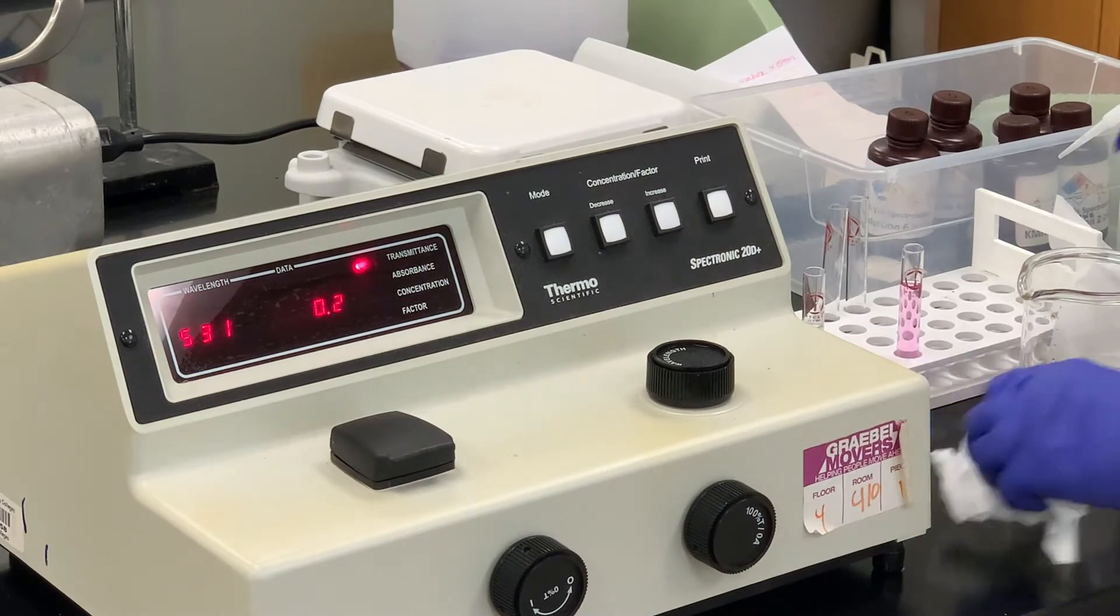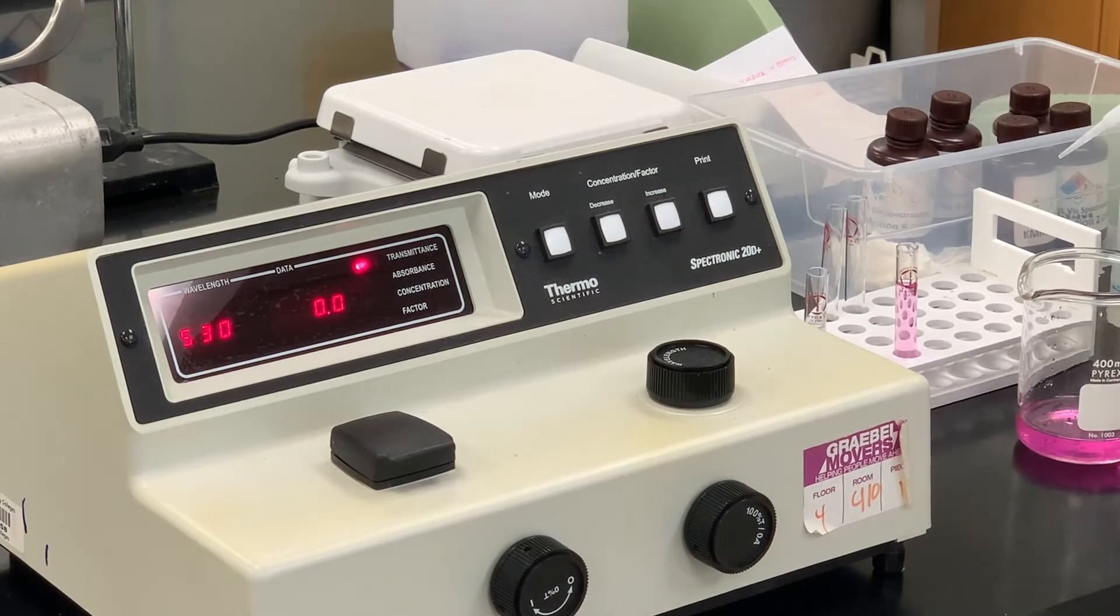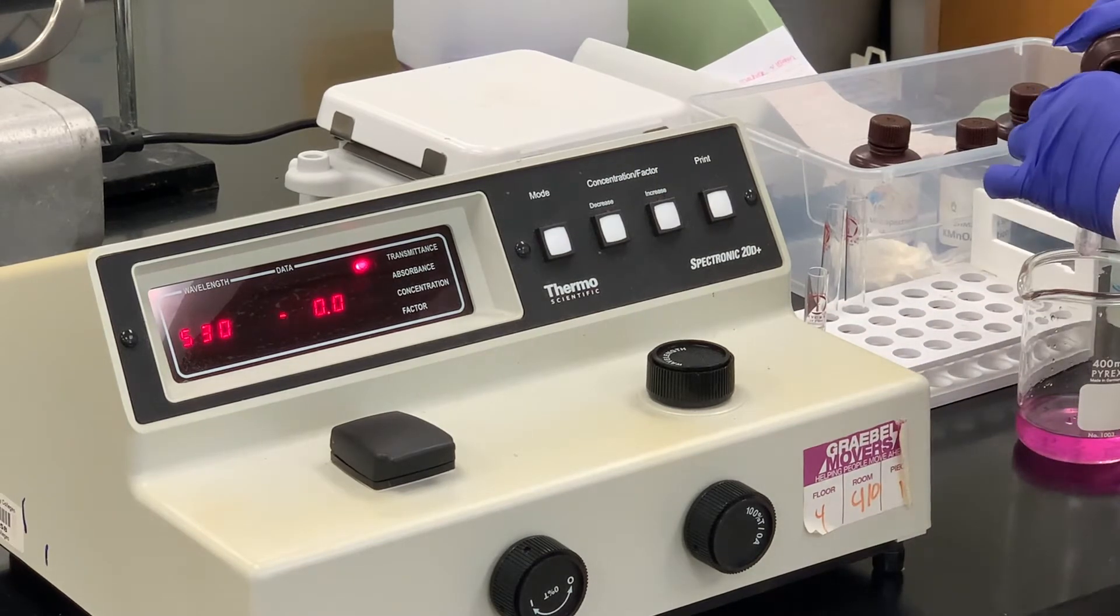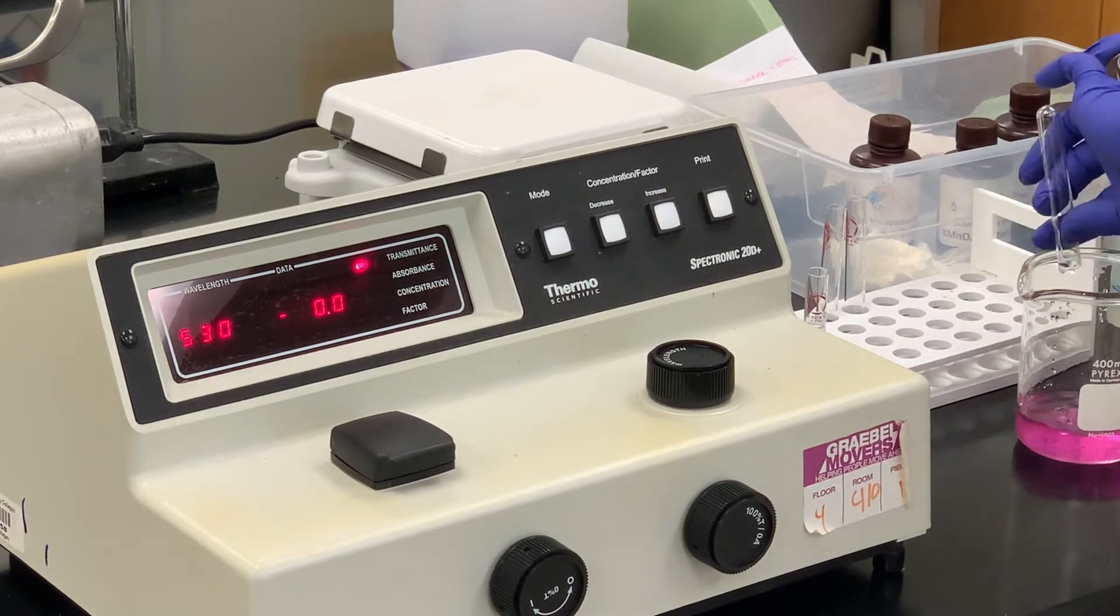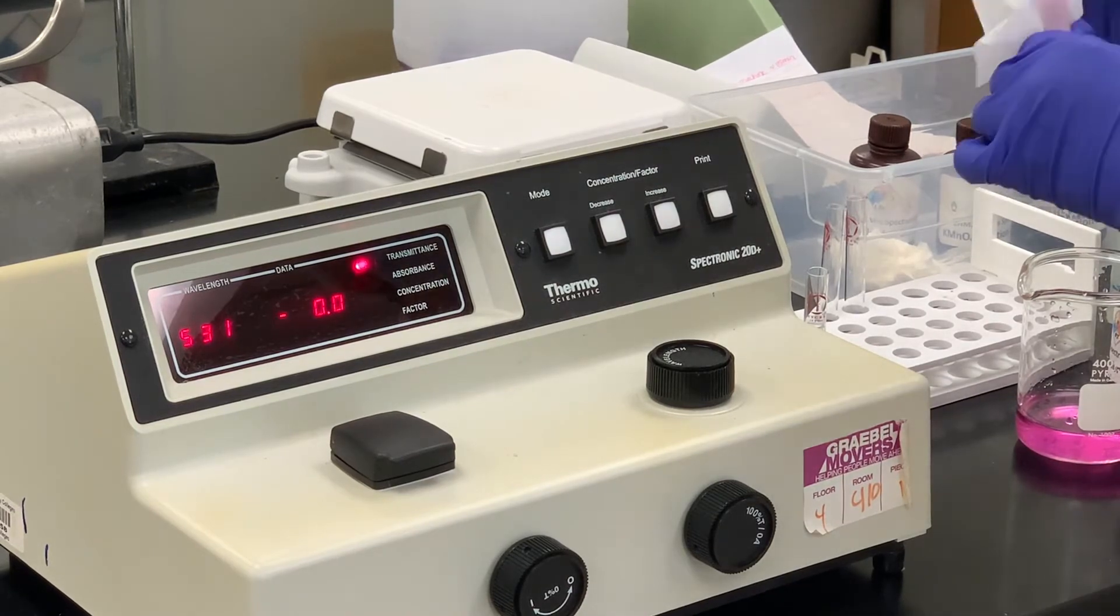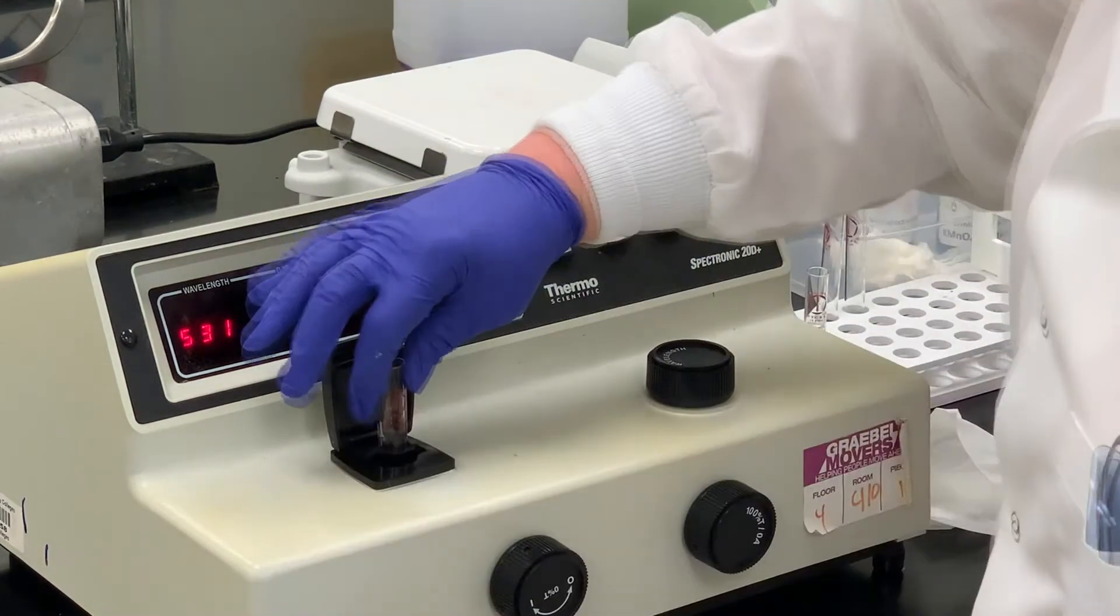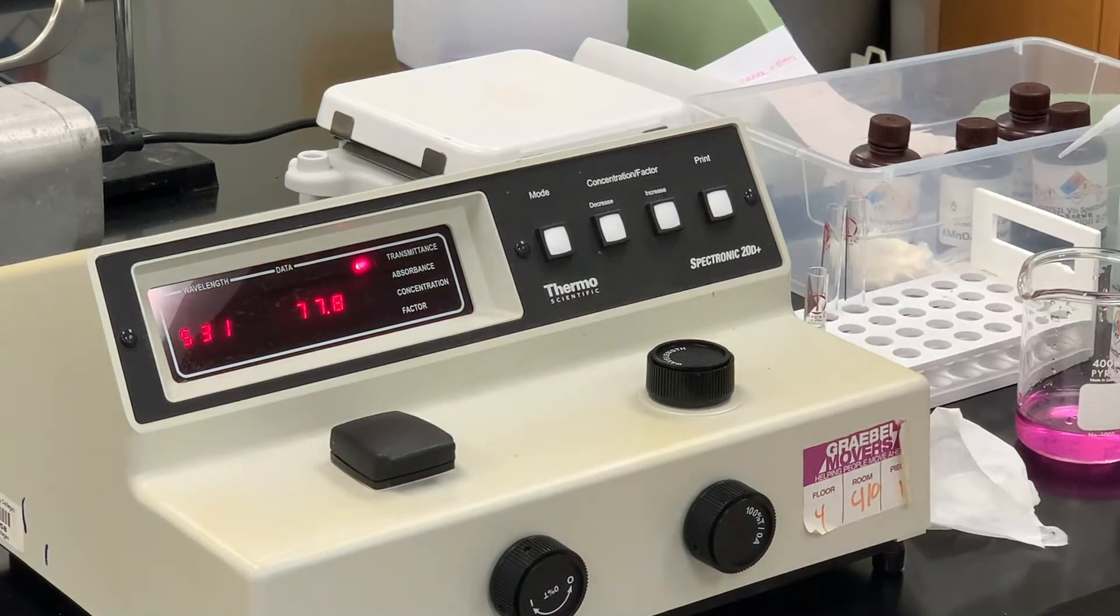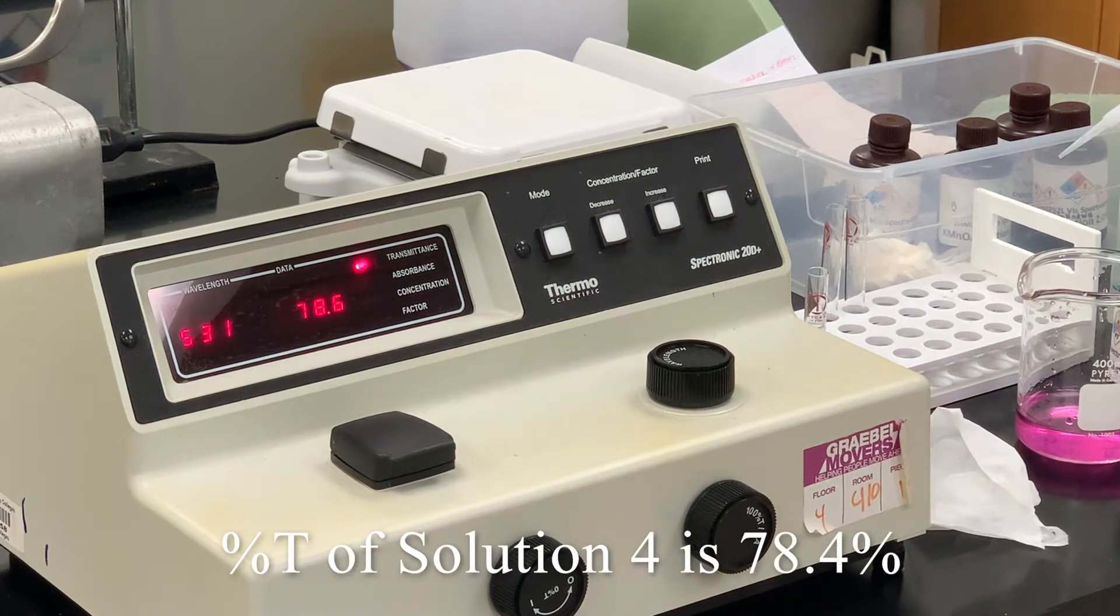Testing again with the water. Make sure it's at zero. Moving to solution four. And solution four is 78.4.